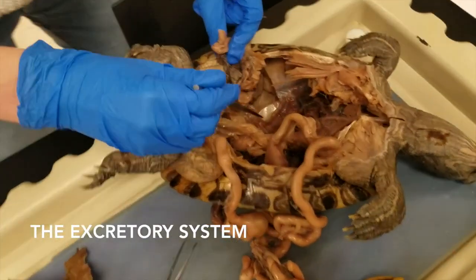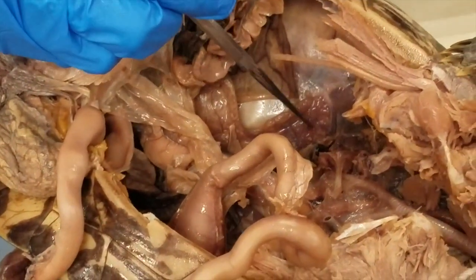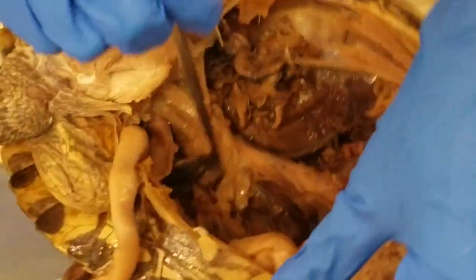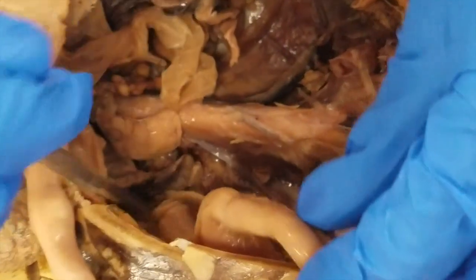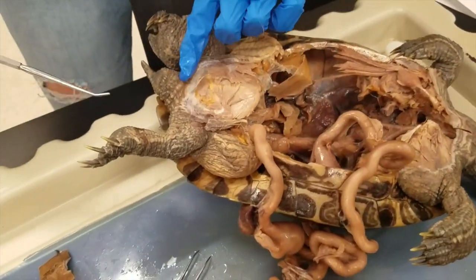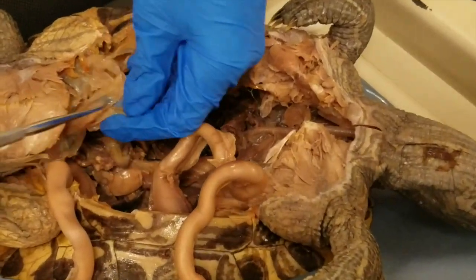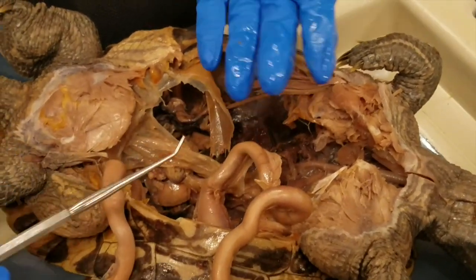For the excretory system, we have the kidneys right here, and they filter out waste from the blood. Here is the kidney on the other side — it's kind of underneath all of this. We also have the cloaca, which is the opening at the end that ultimately expels waste out of the organism. We also have the bladder, which is where they store their waste until they are ready to expel it.